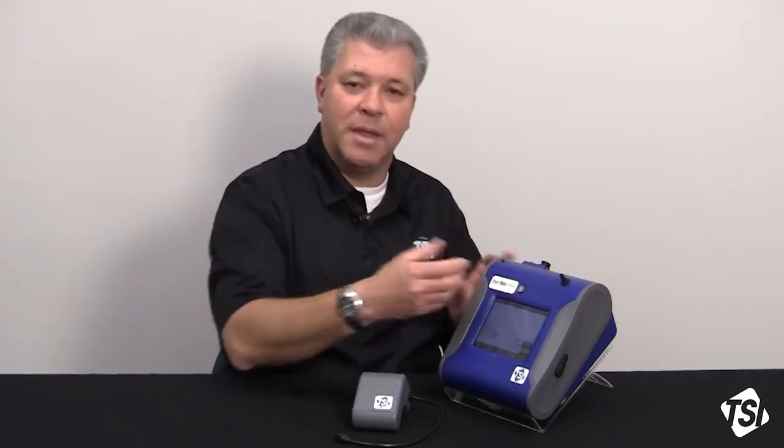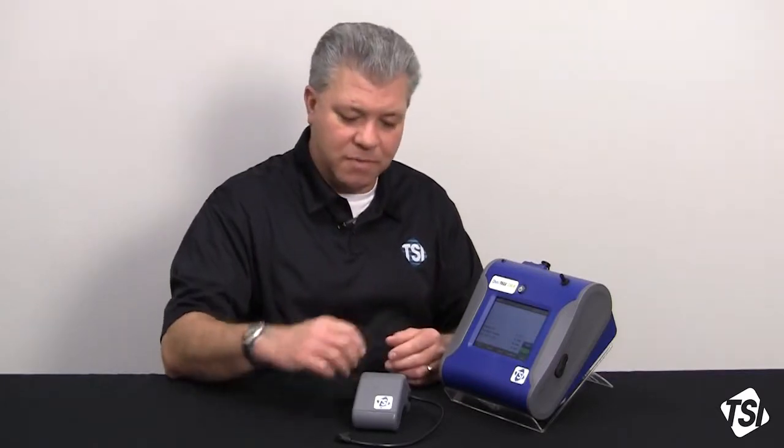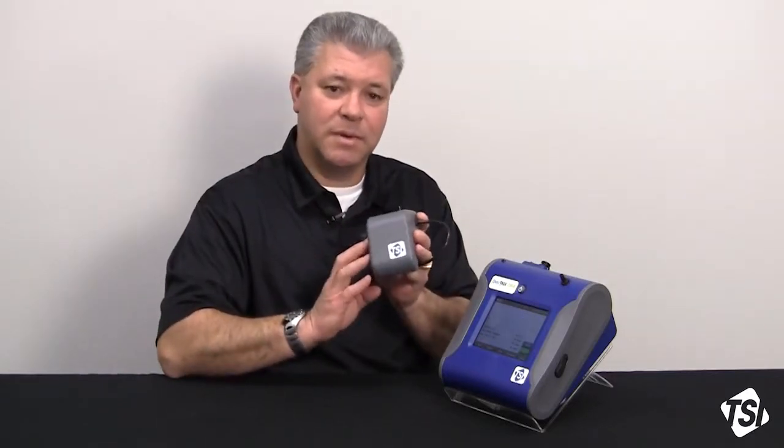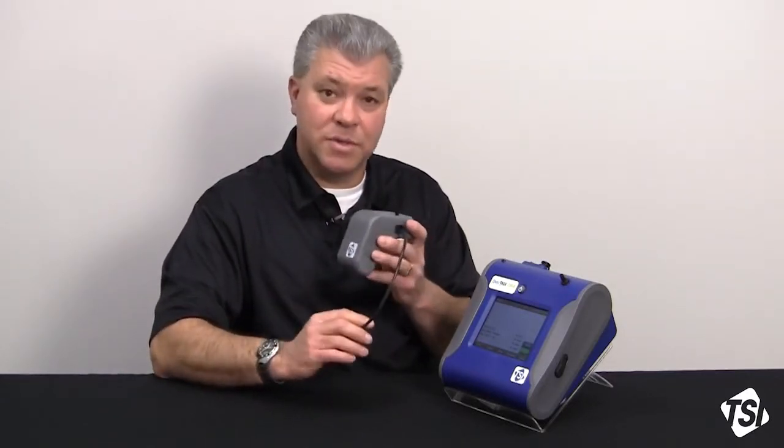You can't go out, stop your instrument, zero it, and then restart it again. You've lost the continuity of your sample, so now you have multiple data sets, and so on and so forth. This will allow you to run continuous sampled data sets. It will also allow you to zero during longer periods, number one, for electronics drift.